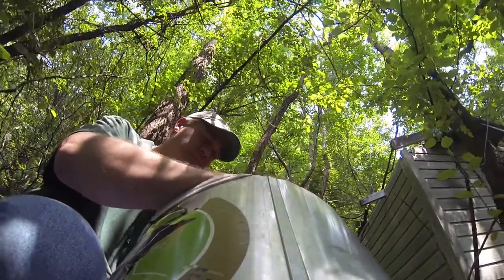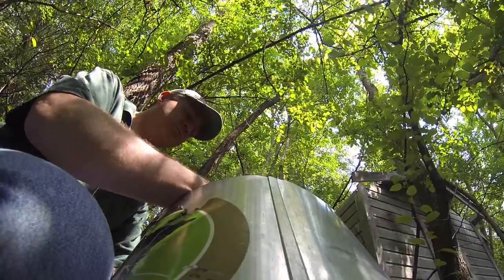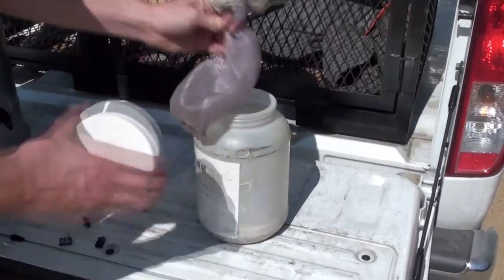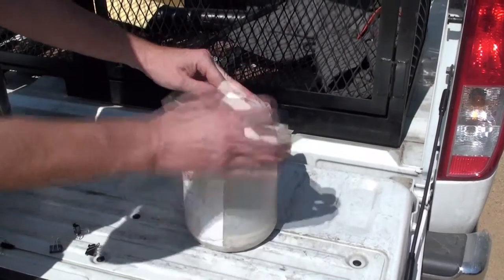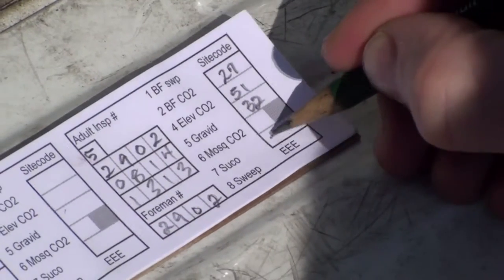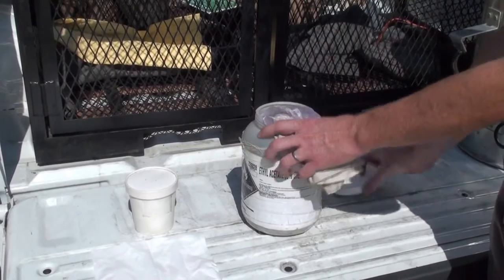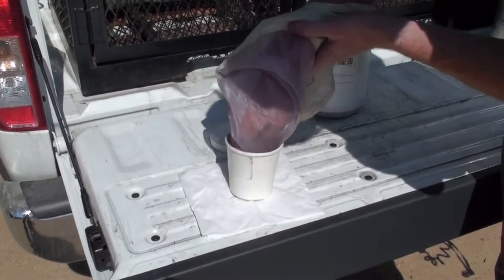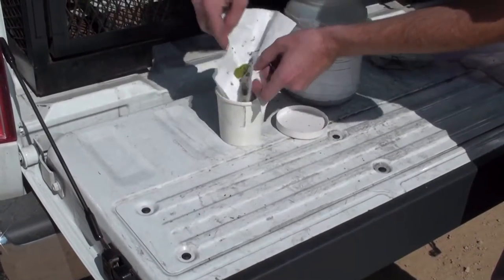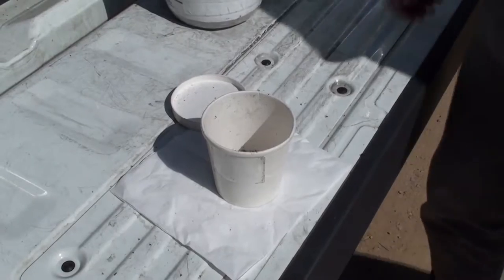Before killing the power to the Succ-O-Matic, remove the net from the opening. Pinch the net closed above the insects and shake it inside the opening so the air flow pulls the insects further toward the bottom of the net. Twist the net closed as far down as you can without damaging the sample. Head back to your vehicle, place the net in the kill jar, and secure the top of the jar. Before moving to the next site, complete the data entry for the sample you just collected. Fill out the adult mosquito sample label and place it in the window of the container. When all of the insects in the kill jar are dead, transfer them to the labeled container. If it's windy, you should do this inside the vehicle. It's helpful to have a sheet of paper or card stock under the sample container to catch any mosquitoes that spill.